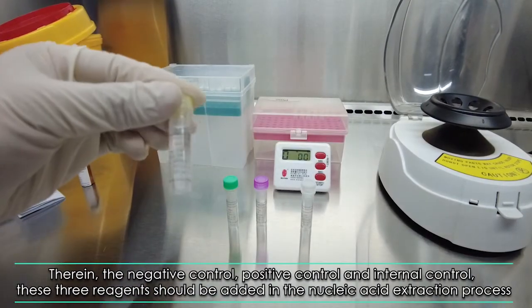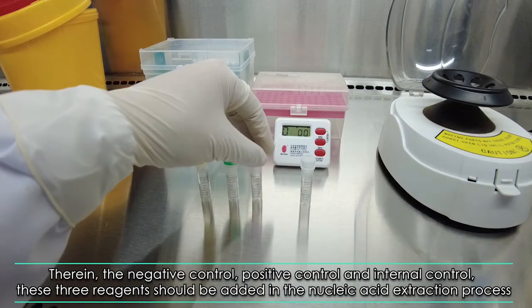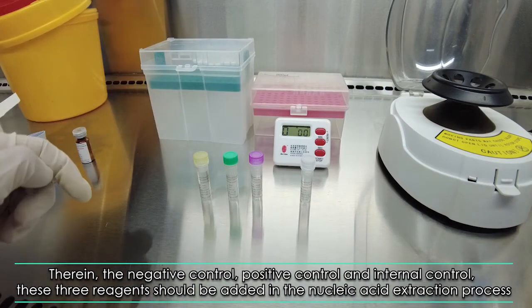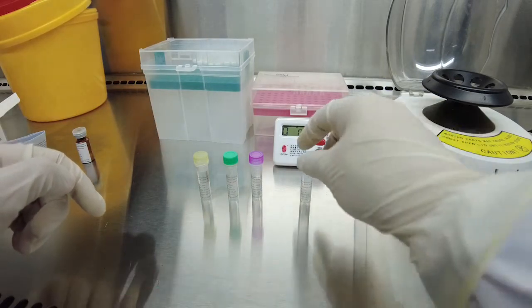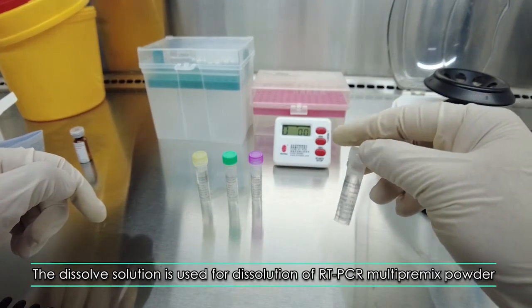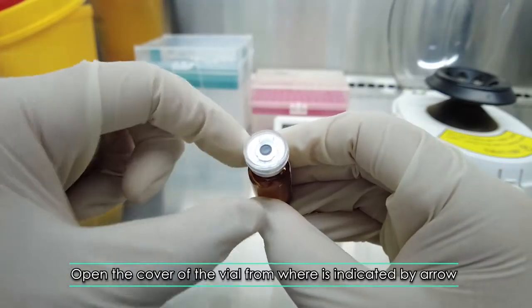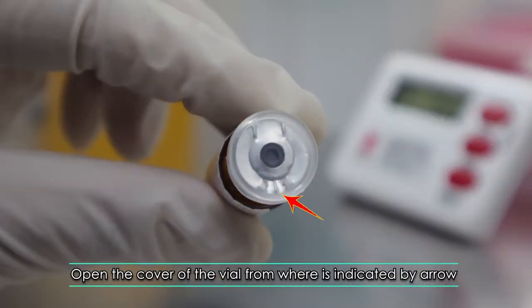Therein, the negative control, positive control, and internal control, these three reagents should be added in the nucleic acid extraction process. The dissolved solution is used for dissolution of RT-PCR Multipremix Powder. Open the cover of the vial from where is indicated by arrow.